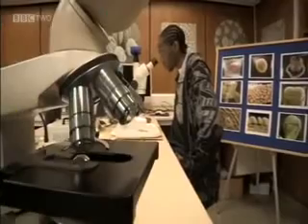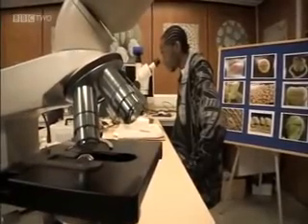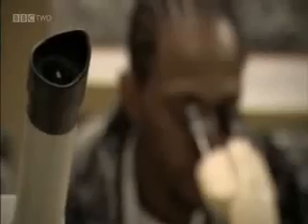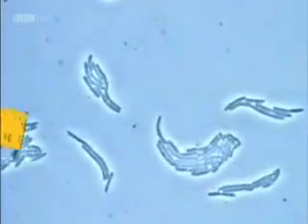But light microscopes have a limit. Any object that's smaller than the wavelength of light appears blurred.